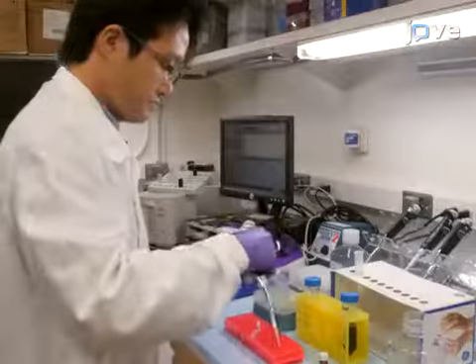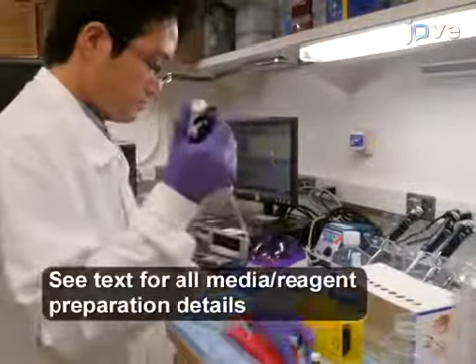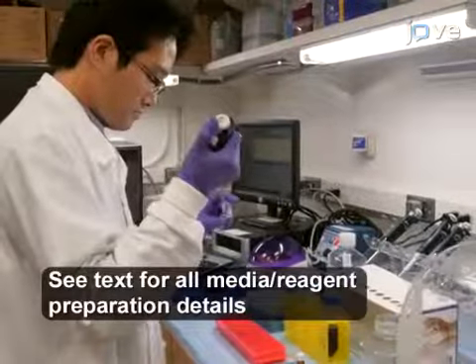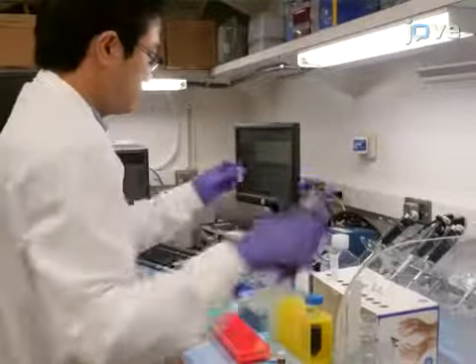For IR700 conjugation to monoclonal antibodies, incubate the antibodies of interest with IR700 in disodium phosphate in a microcentrifuge tube at room temperature for one hour, covered in aluminum foil.